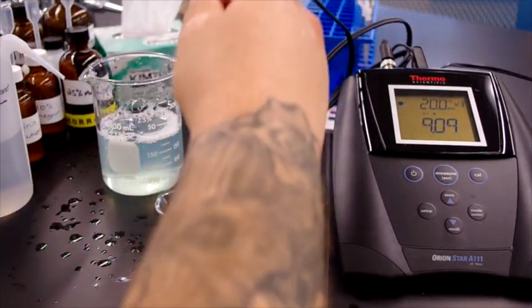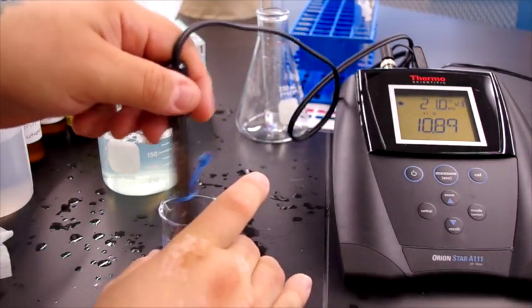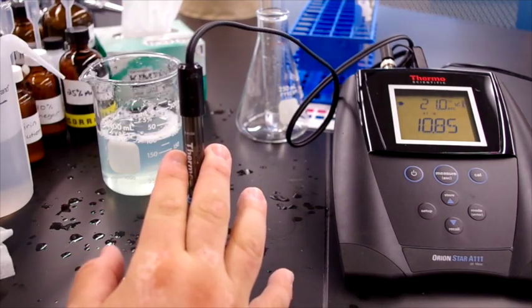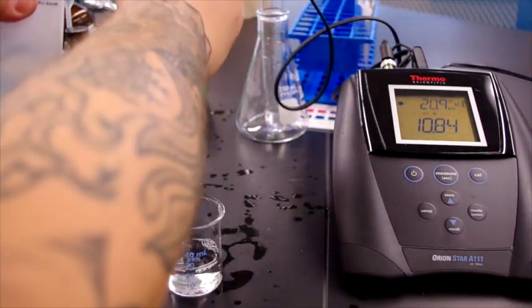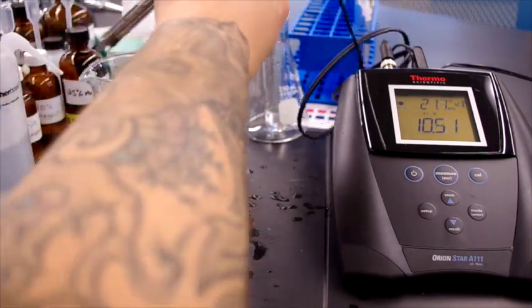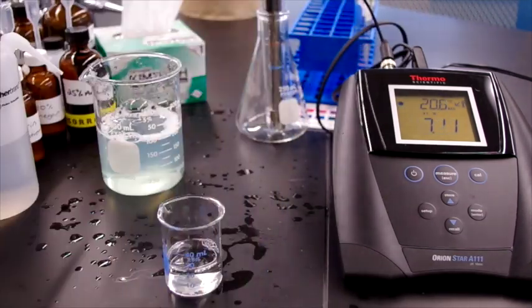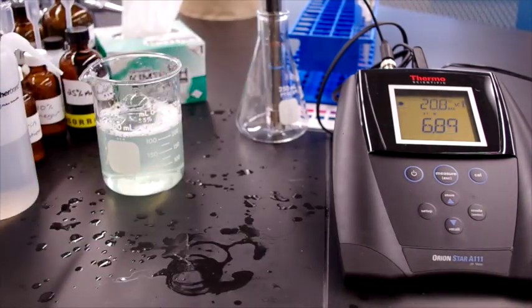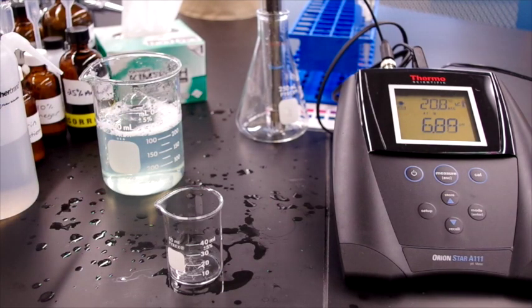Right, now ammonia is very basic, has a pH around 10.85. And we pour our waste. That'll make a cool color. And the last one that we're going to do is seawater.